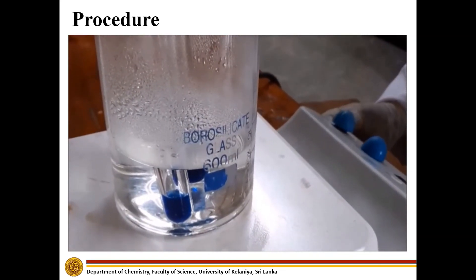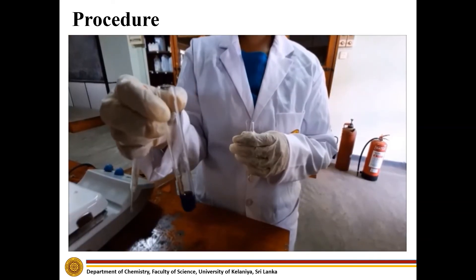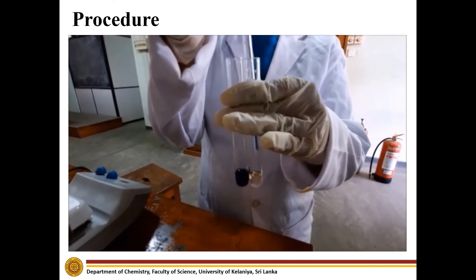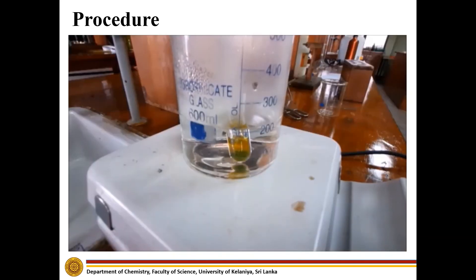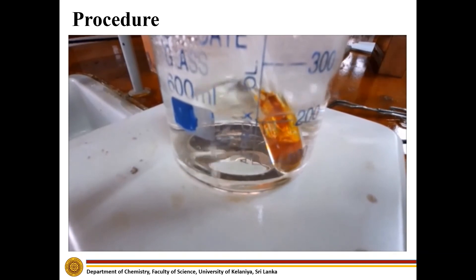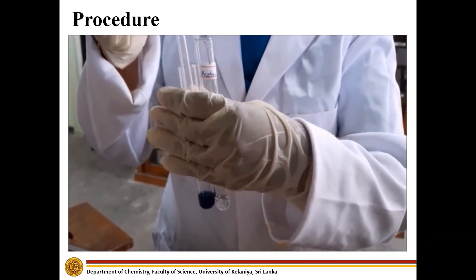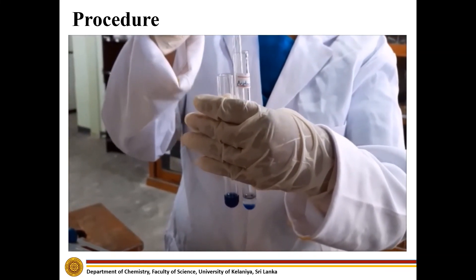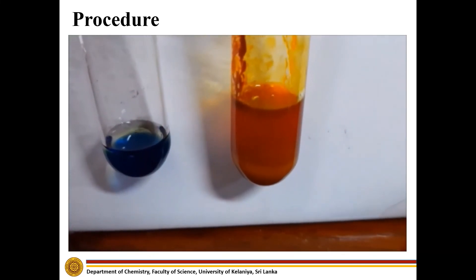Mix Fehling's A and Fehling's B solution and boil the mixture for 2 minutes. Add the prepared Fehling's reagent into acetaldehyde — you can see a reddish brown precipitate is developing in the test tube. Add Fehling's reagent into acetone — for acetone, you cannot see a reddish brown precipitate.